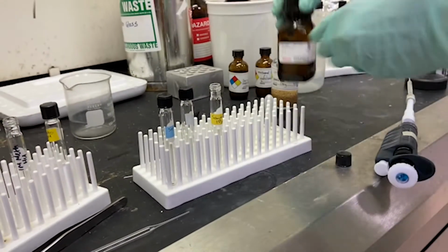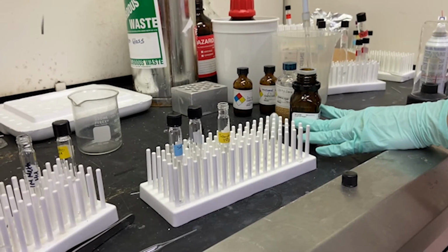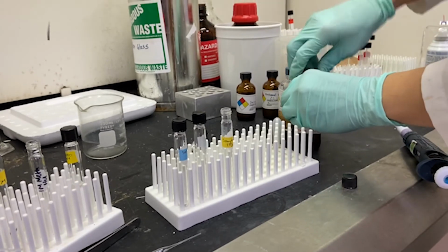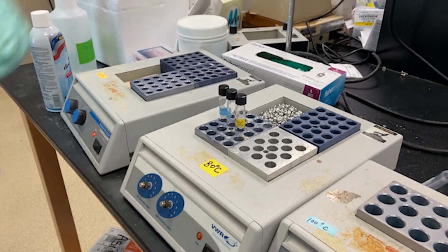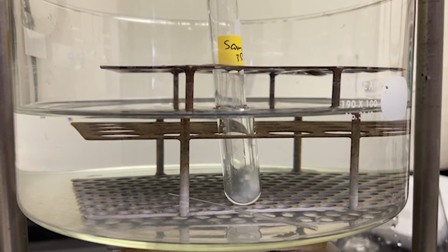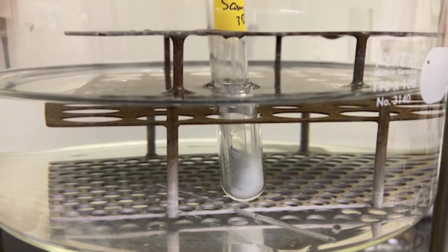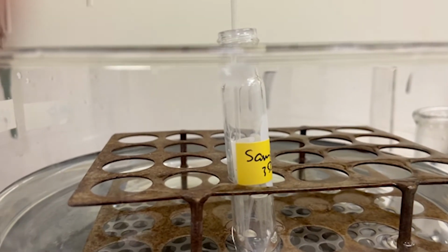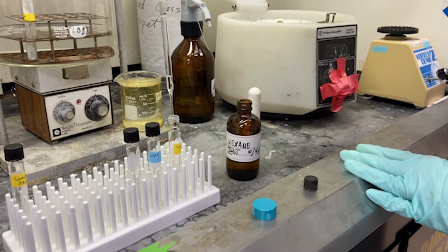After our samples are completely dry, we add 200 microliters of our TMS reagent, or Trisil, which is used to volatilize them and make them O-TMS residues. This is then put on a 80 degrees Celsius heating block for 30 minutes. After heating for 30 minutes, the sample is then taken off and dried down under nitrogen stream almost completely. It is important to be careful to not over dry your sample or you could lose it because the sample will now be volatile. Next, 500 microliters of hexane is added to the sample to reconstitute it.